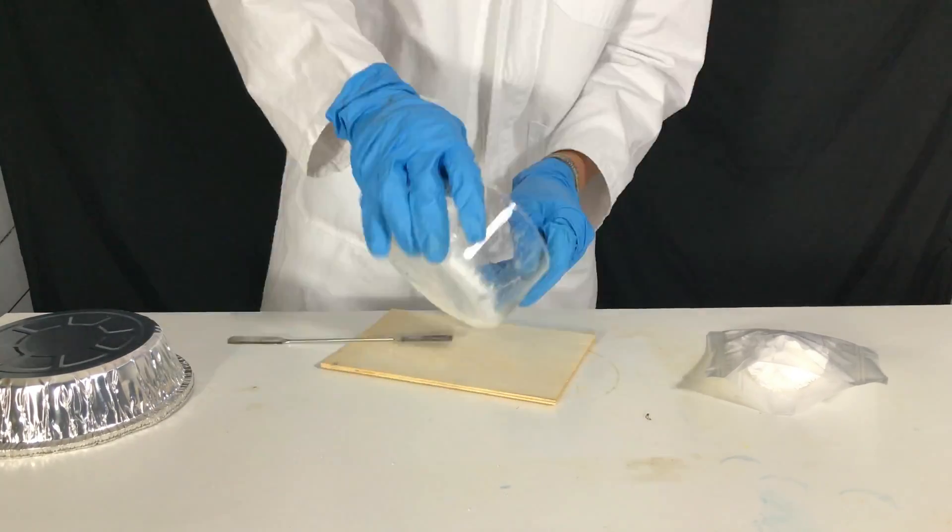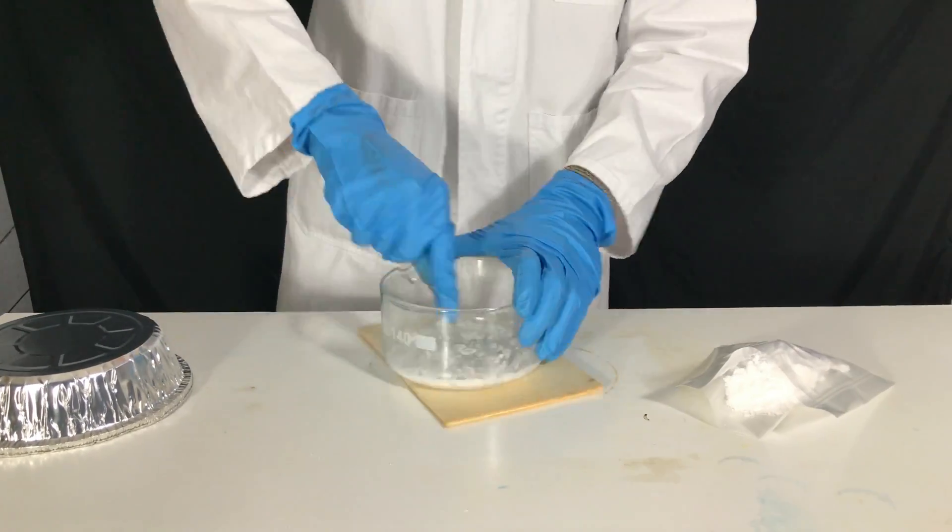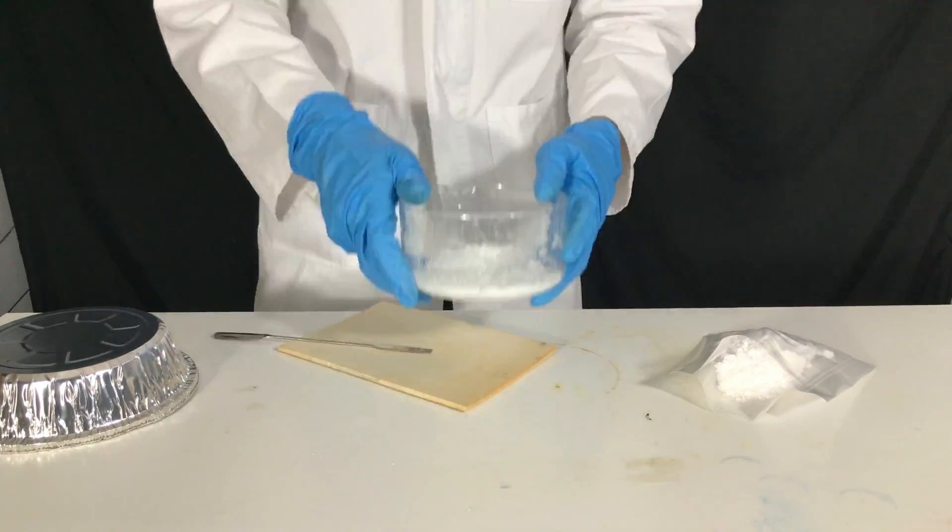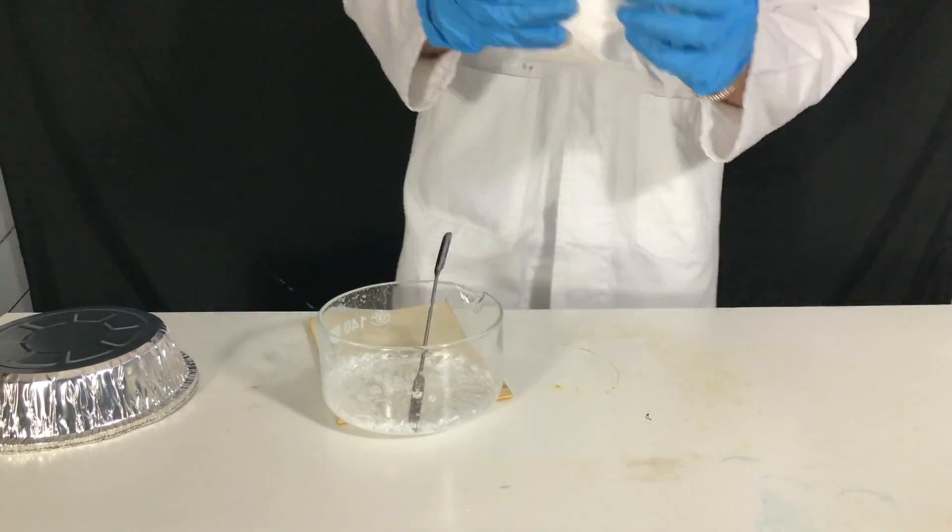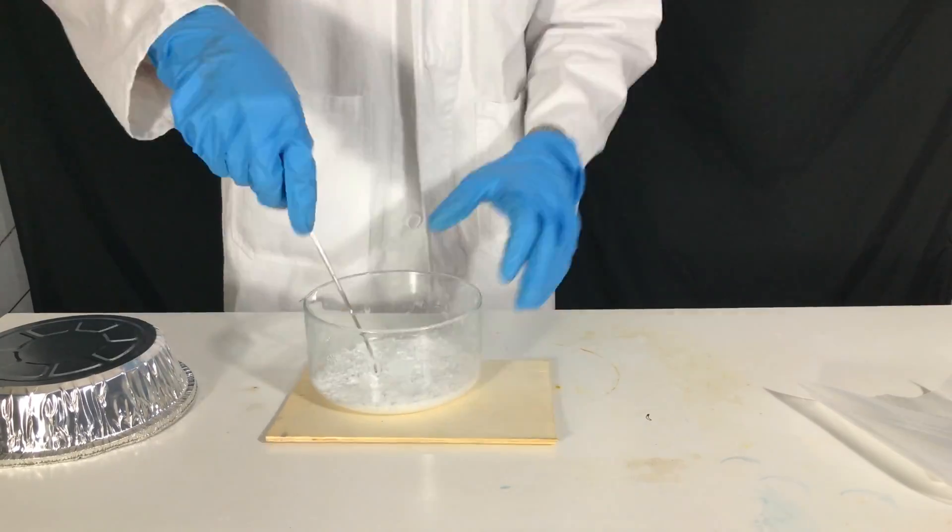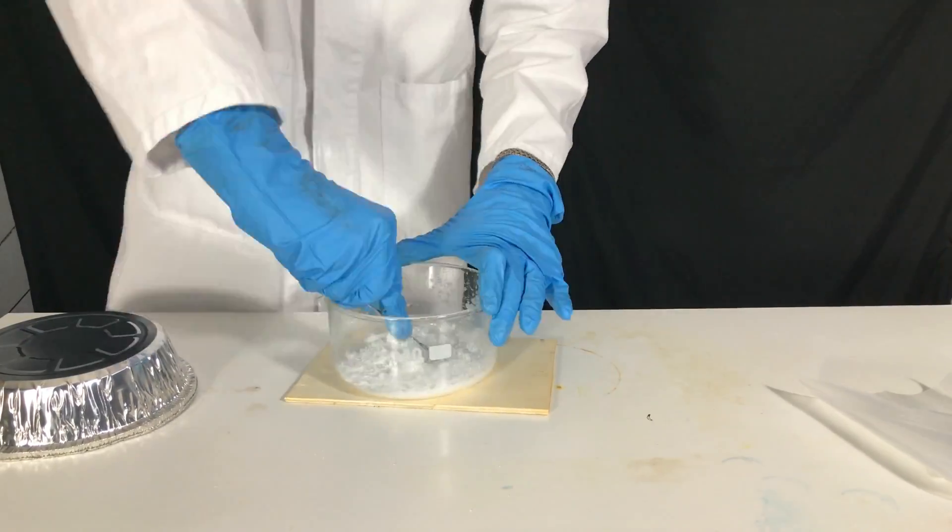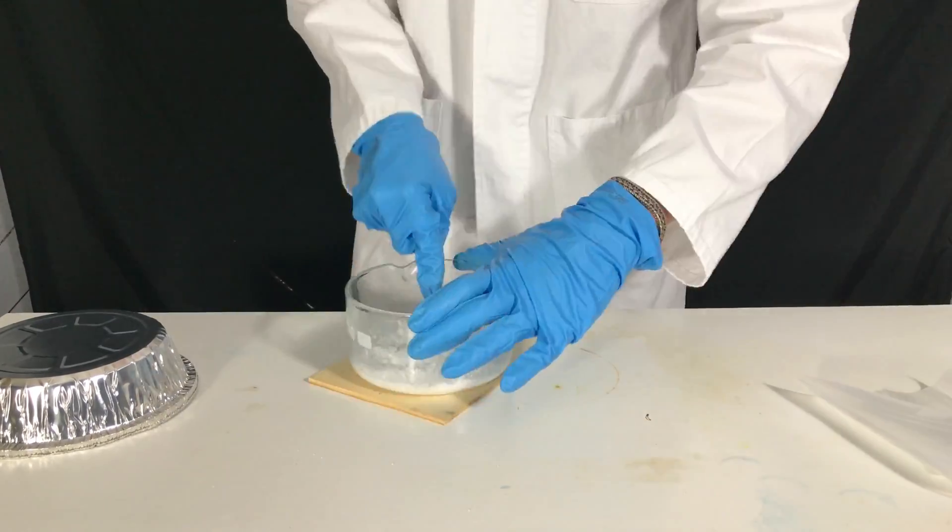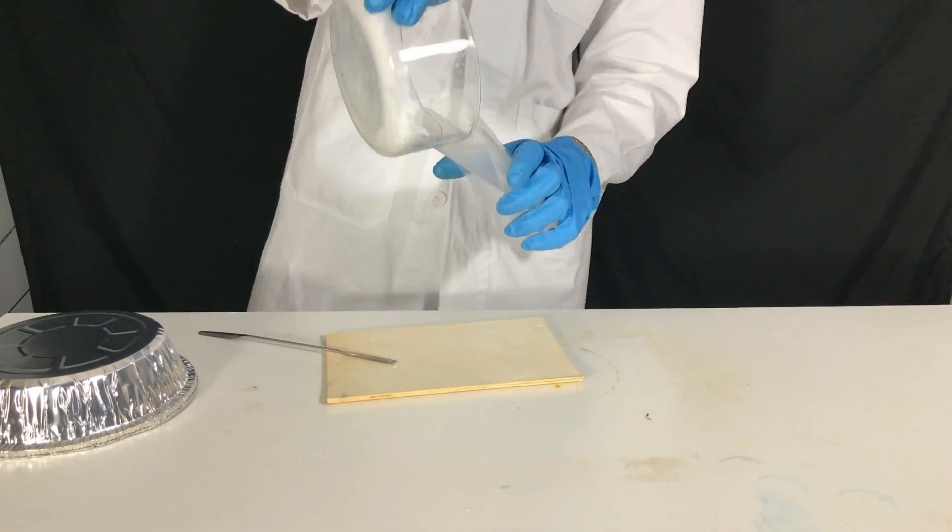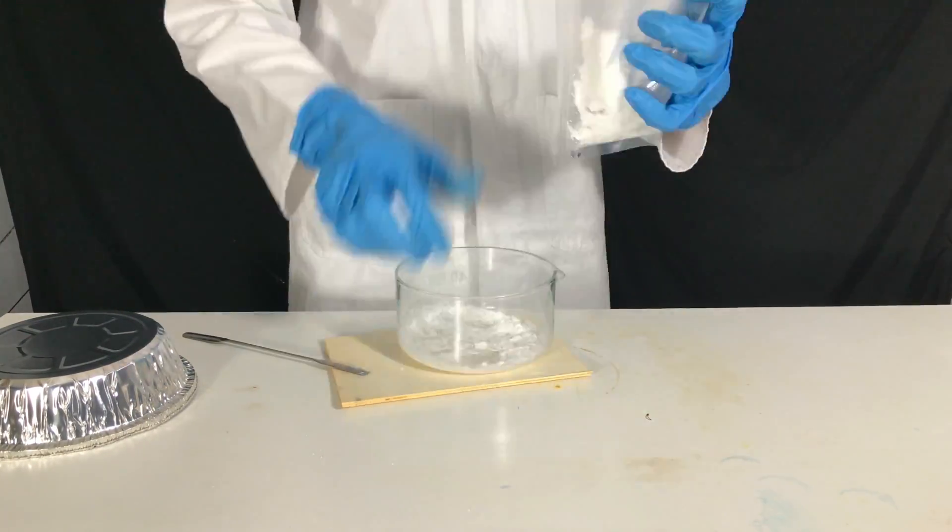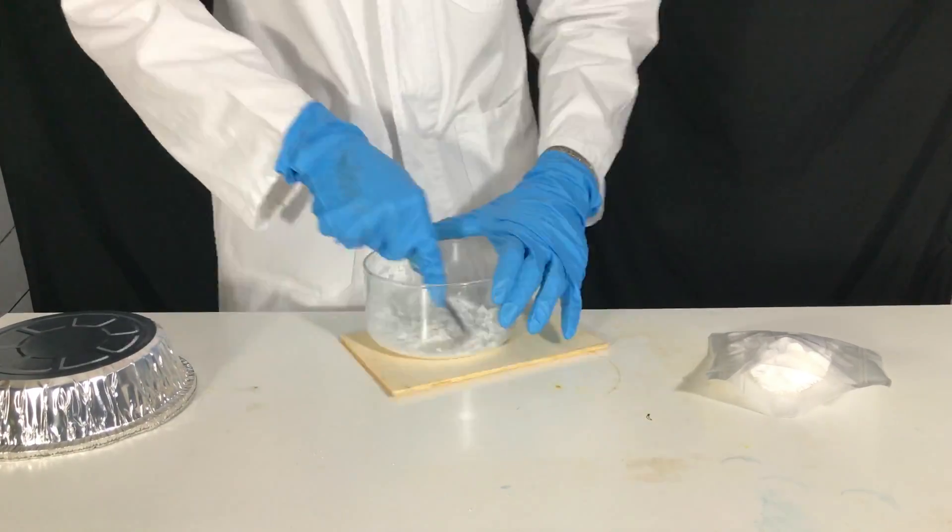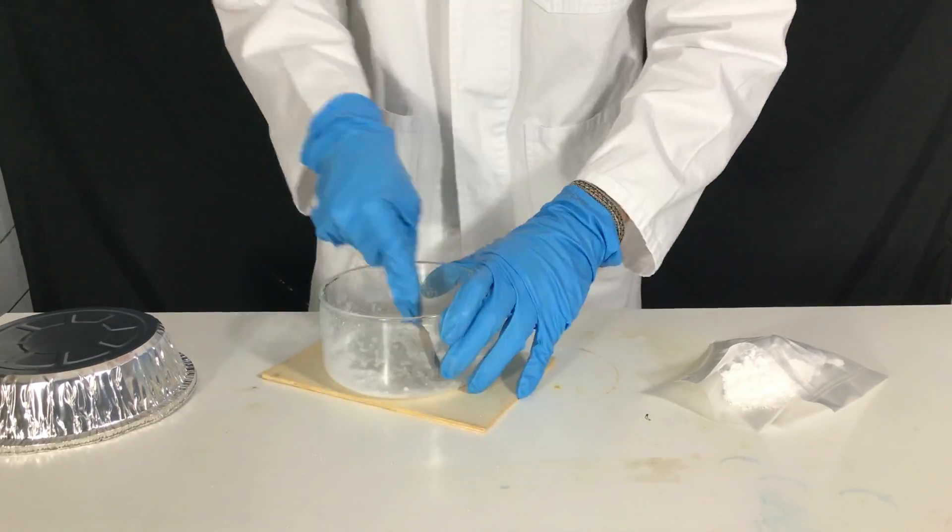Because I am going to use the sodium formate exclusively for one reaction, I decided to vacuum package it. I am not going to tell you by now what we are going to use this sodium formate for. But I promise that it will be an interesting synthesis of a chemical never seen before on YouTube. There is a good chance that you haven't even heard of this chemical yet. Stay tuned!